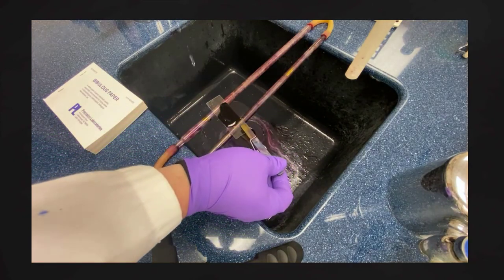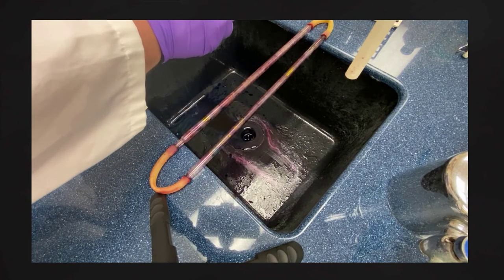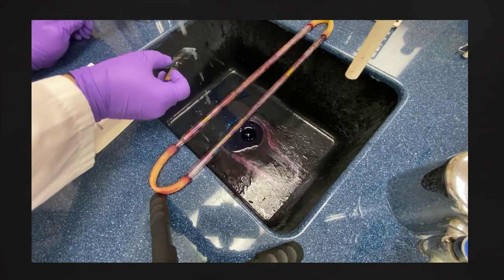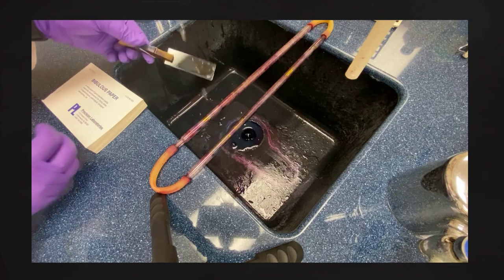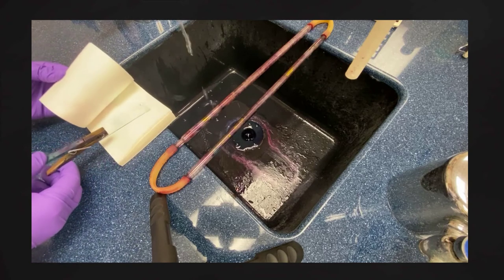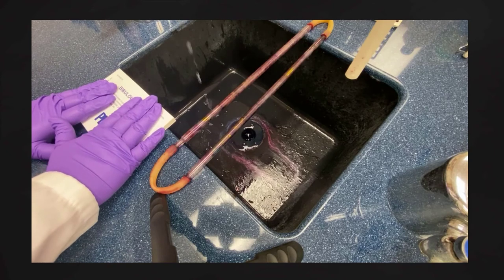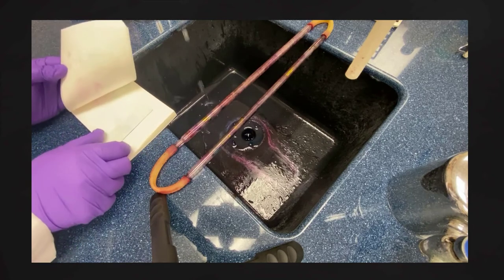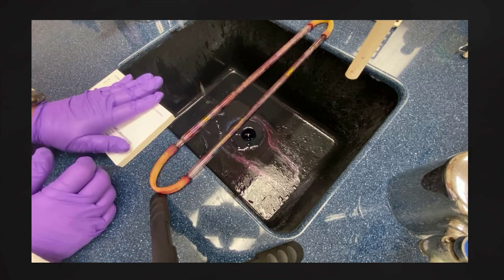After the stain has been on for about a minute, we're going to rinse off the excessive dye, letting it go down the sink and rinsing until there's no more dye present on the slide. Remember, this is a cooled heat-fix smear, which means the bacteria are fixed to the slide and should not come off with running water. We then want to dry the slide using the bibulous paper — pat gently, being careful not to apply too much pressure since it's a glass slide that could break. We don't want to rub the smear away, just pat it dry.